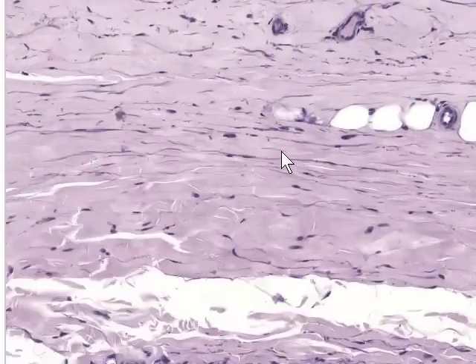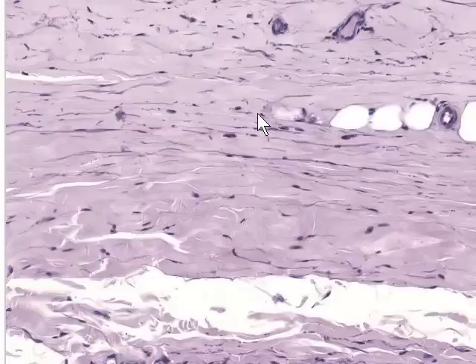And also you should go back to your original connective tissue set of notes and examine the slide that you looked at of aorta, which is stained with H&E rather than with stain for elastic fiber, and compare that with an aorta stained for elastic fibers.